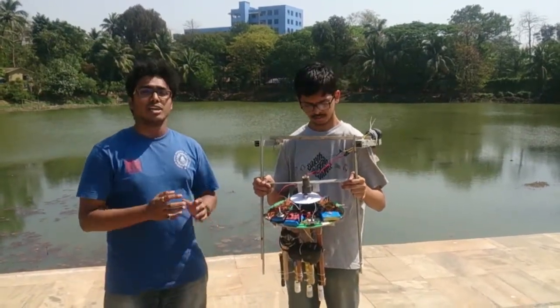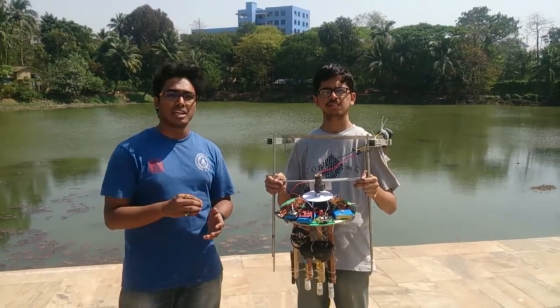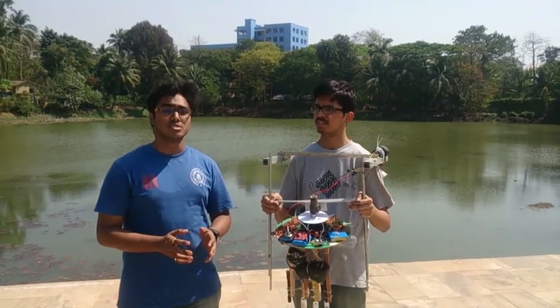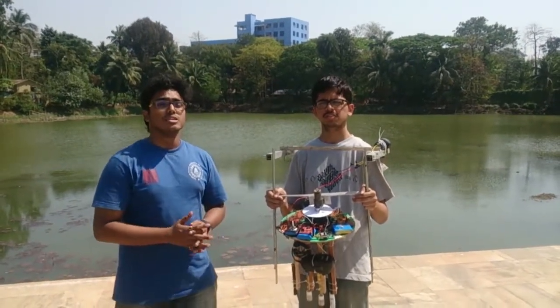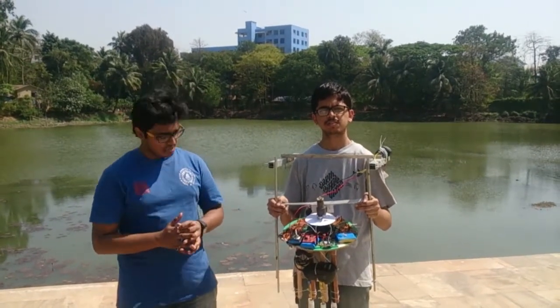Starting from conductivity. Conductivity gives the conductivity of the water and thus states the metal content in the water, since metal conducts electricity. Then we have the pH sensor. pH is a very important sensor since it shows whether the water is acidic or basic. Then we'll go for the ORP sensor. ORP gives the antibacterial strength of the water as well as the bacteria content in the water.